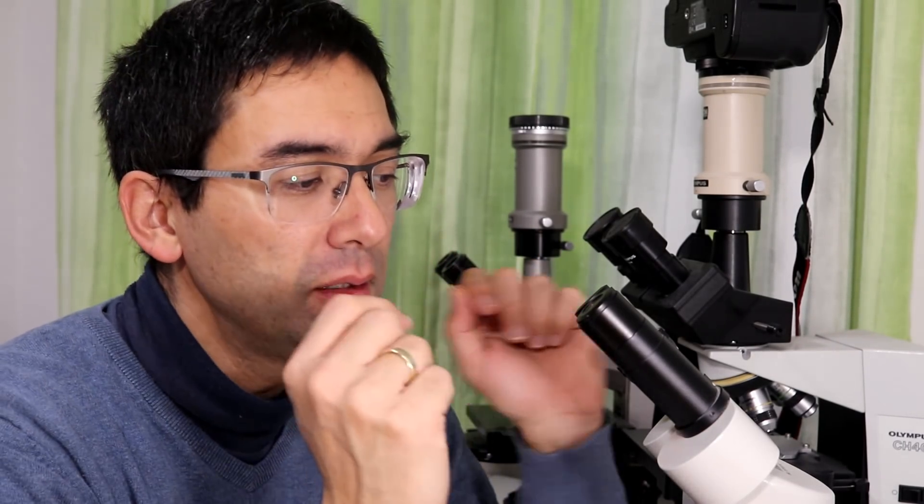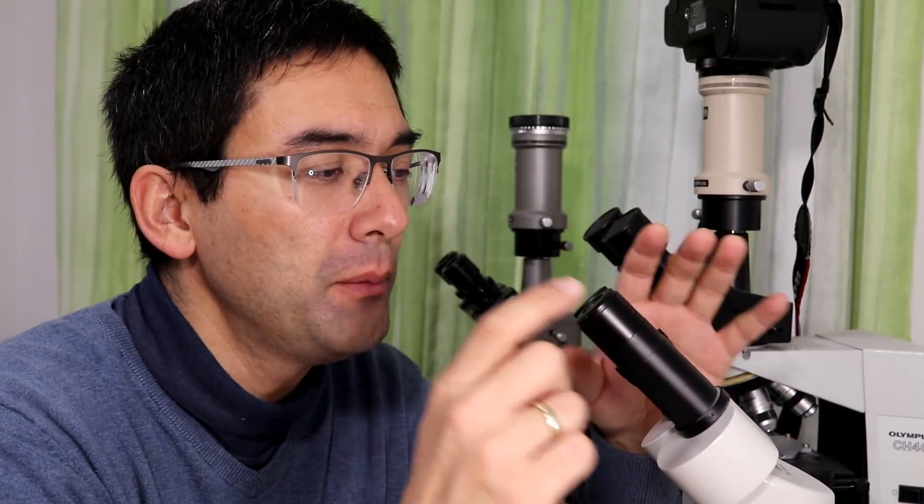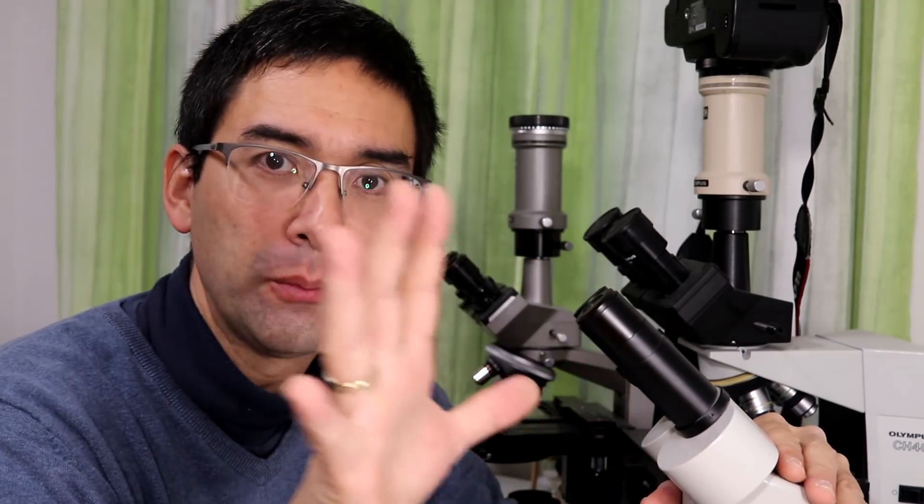And another thing that's really interesting about these stereo microscopes is that because you have two different objectives, actually later on I'm going to show this to you, the two eyes will get a different picture and therefore you will actually get a real stereoscopic impression of the object that you see. So it's quite spectacular.